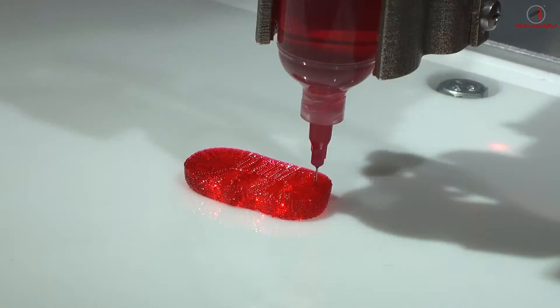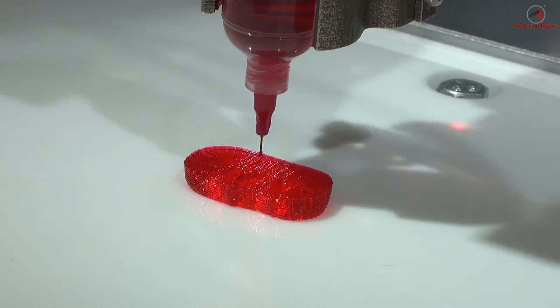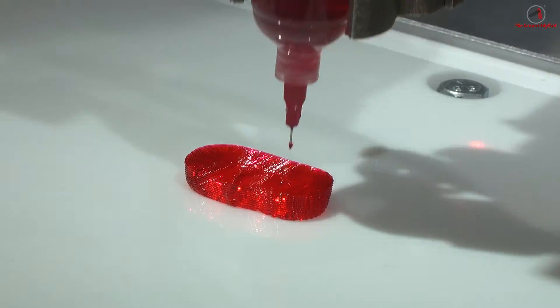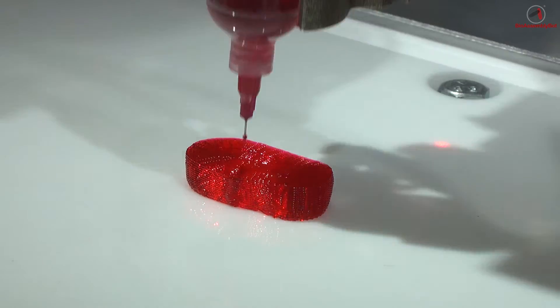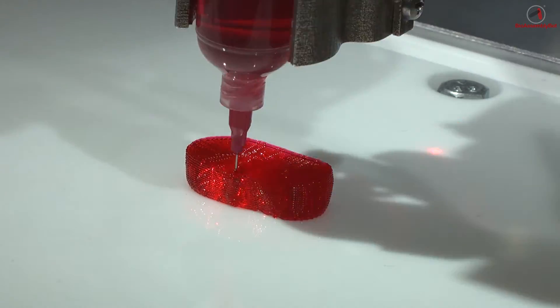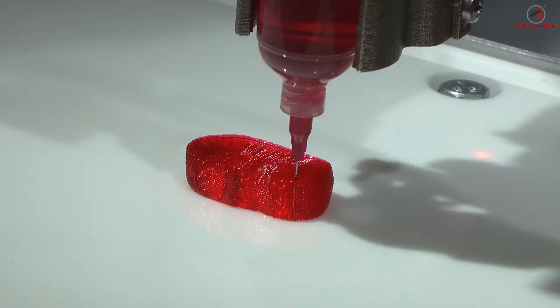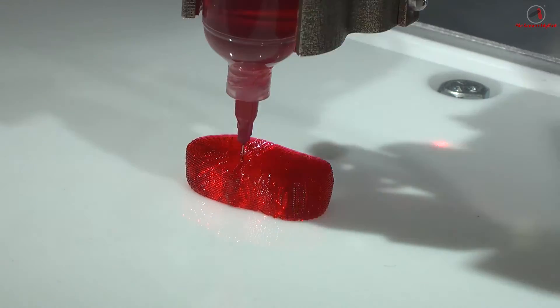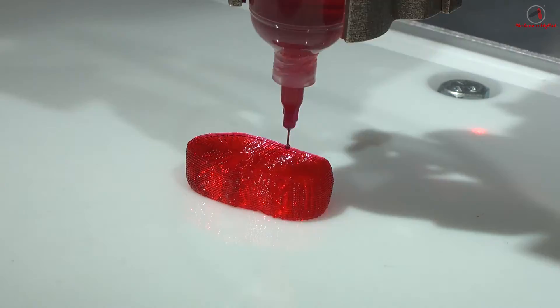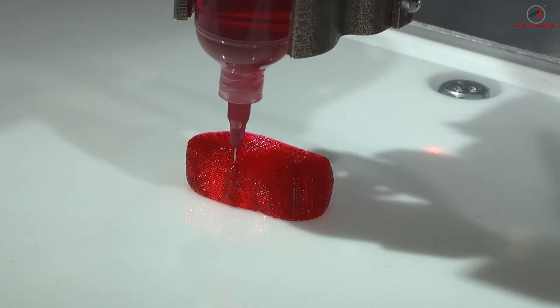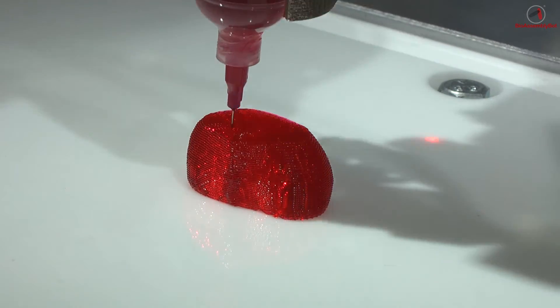Here BAB is printing up the heart itself, in this particular example the upper part of the heart that has those curved surfaces that will receive the new vessels that we want to add to the tissue here in red.